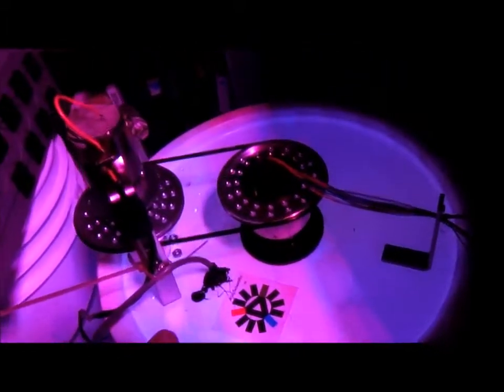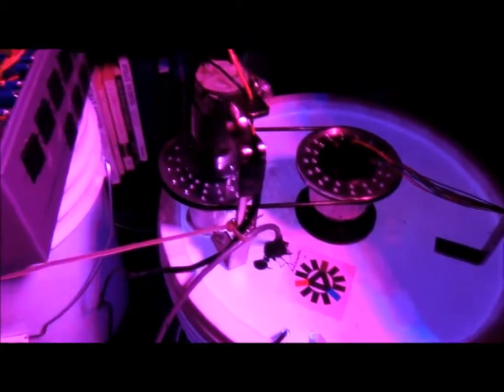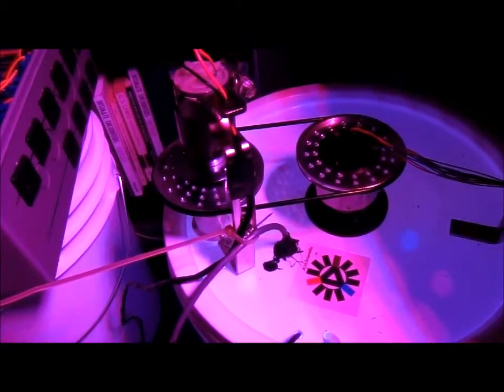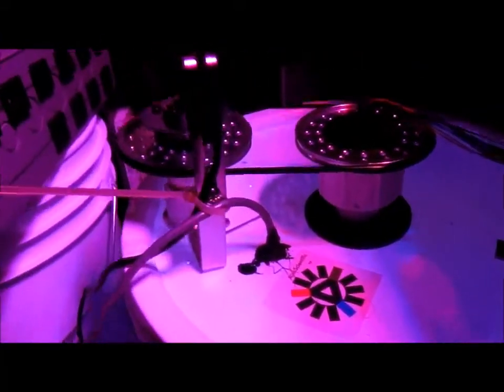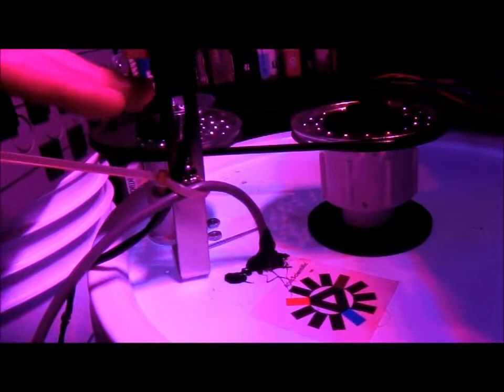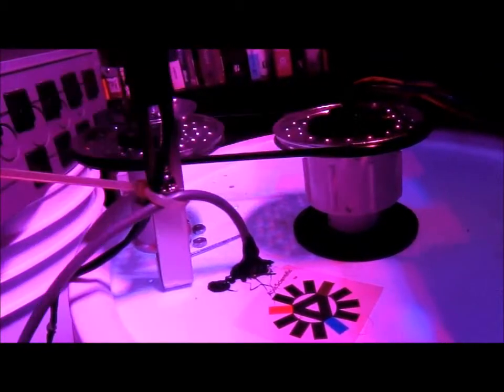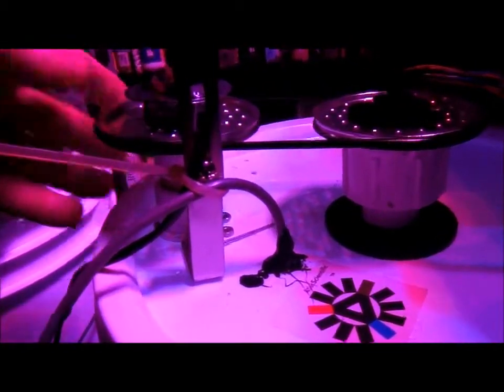I'm not very happy with this particular design. I wish I would have spent more time on it, and the reason for that is on the bucket here—these are slightly offset. This one angles down a little bit while this one's straight over here, and the rubber band tension was really important. But I had limited space to create the tension. Here you can see I'm right up against the rim and not really satisfied with that.